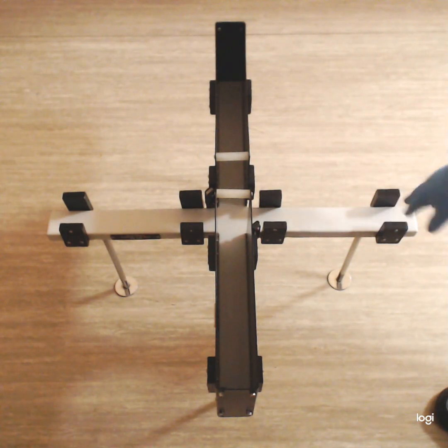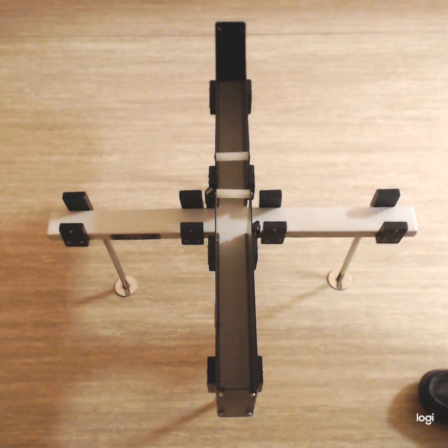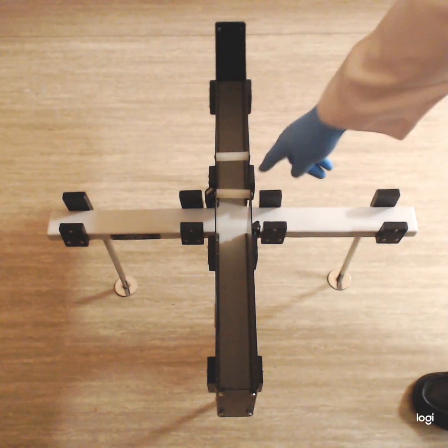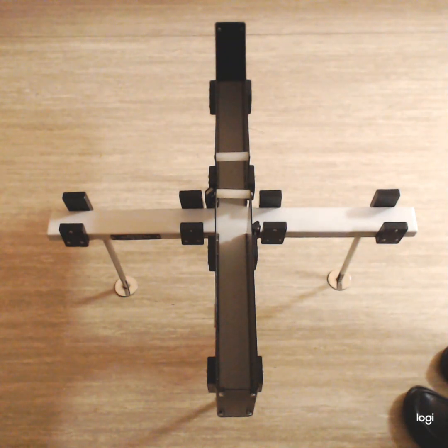The animal will try to stand on its hind limbs and explore the apparatus. Okay, you will see this around the central area. So these are some of the parameters which we can use to study anxiolytic drugs or anxiogenic drugs.